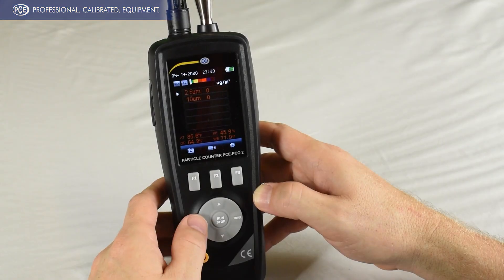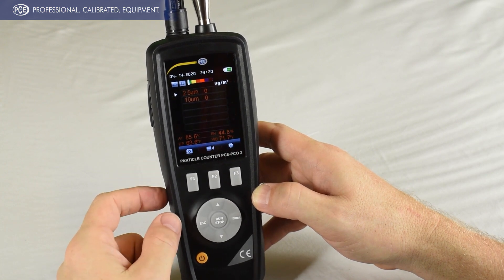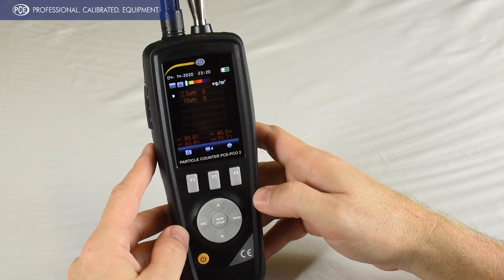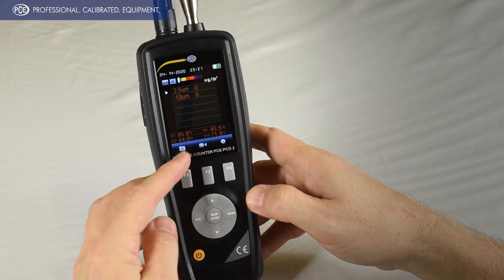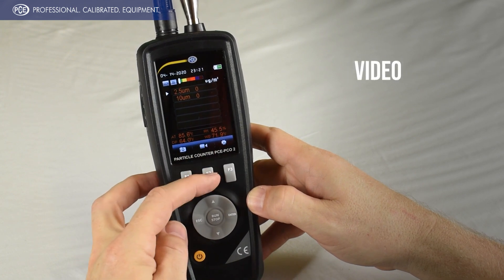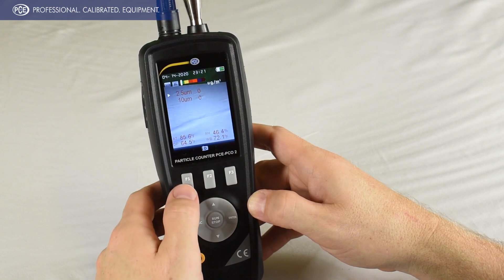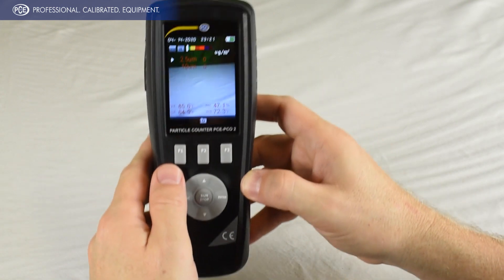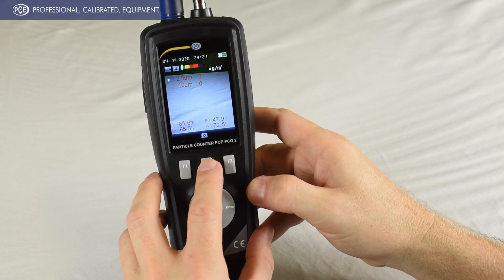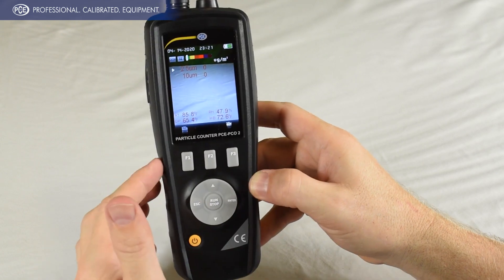One of the other features is that this allows you to take photos and video, so you can have the date and time information for the area that you sampled. For that, you would hit the camera — F1 here for still photos or F2 for video. You would hit F1, and then it shows your information and the location. Hit F2 to take the picture and that saves to your internal memory.